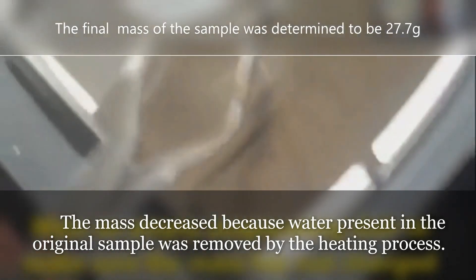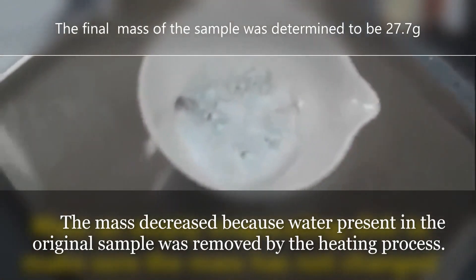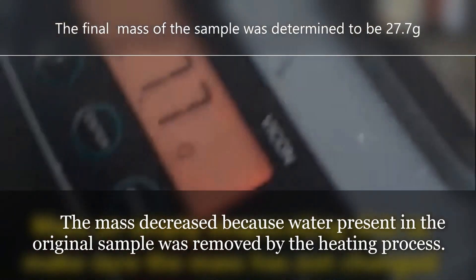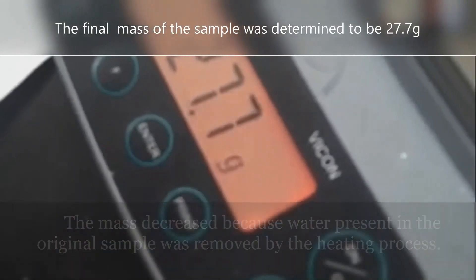After heating, the combined mass of the anhydrous copper sulfate and dish was 27.7 grams.